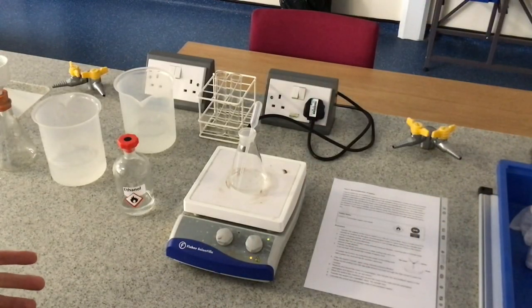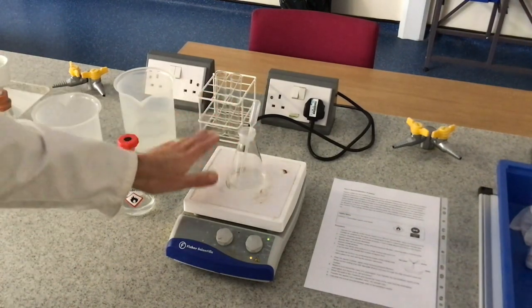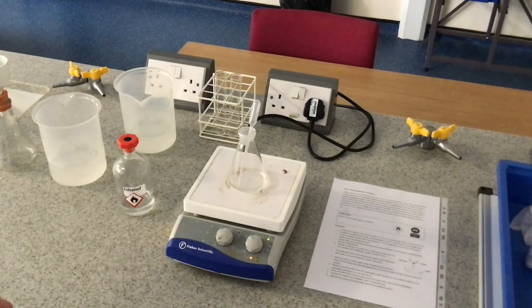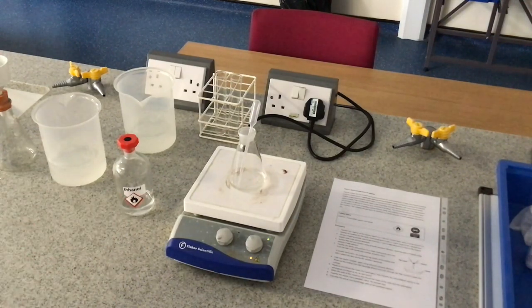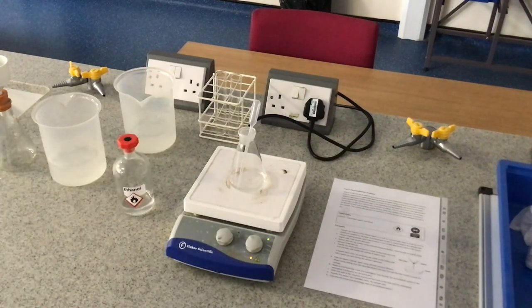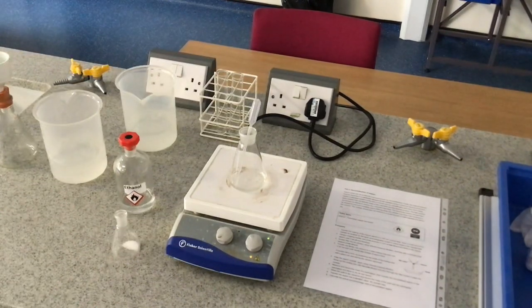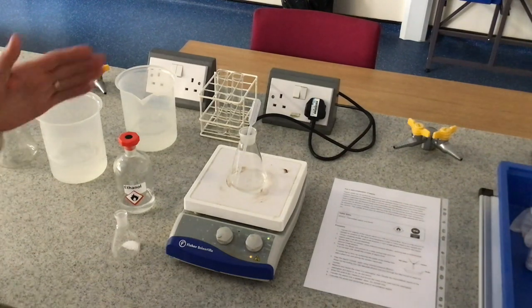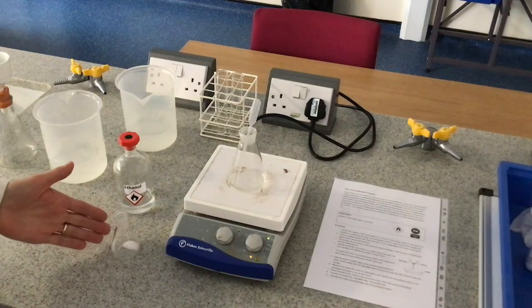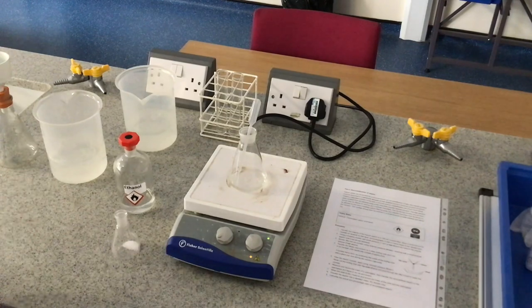Now we've chosen the solvent, we've got a small amount of ethanol in this conical flask sitting on a hot plate. I'm not using any naked flames — ethanol is flammable. So we're getting this as hot as we can so that we can dissolve the aspirin in the minimum amount of the hot solvent. I'll explain why that's important later. So what I'm going to do is transfer a drop at a time of ethanol into my aspirin and dissolve it — but remember I don't want to add too much, minimum amount of hot solvent.